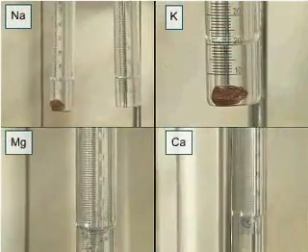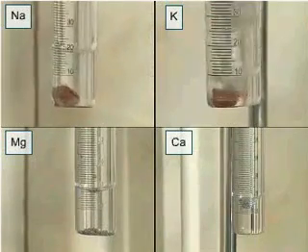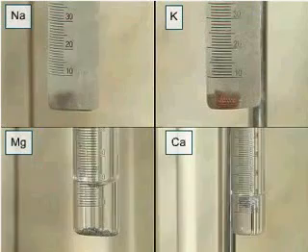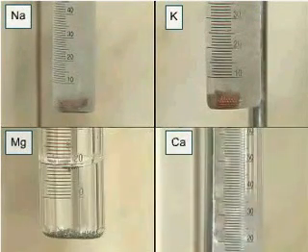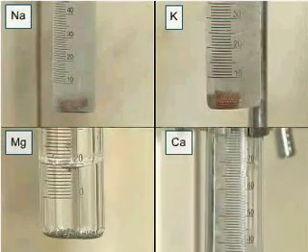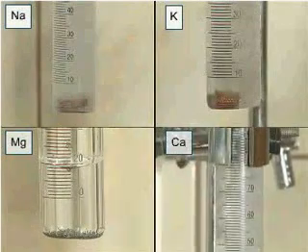In all the cylinders, we can see the metal effervescing with the release of gas. However, the speed of reaction varies among the samples and decreases in the order potassium, sodium, calcium, magnesium.